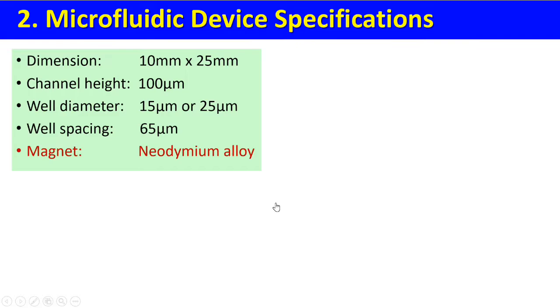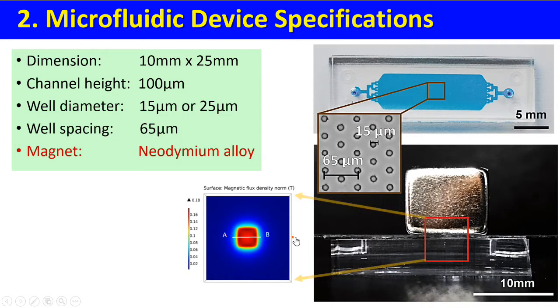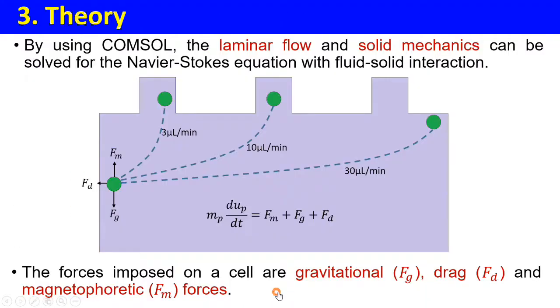2. Microfluidic device specifications. These are the device parameters. These are the well parameters. This is the magnet used in our study. These are the magnet parameters. These are the modules used in our simulation.